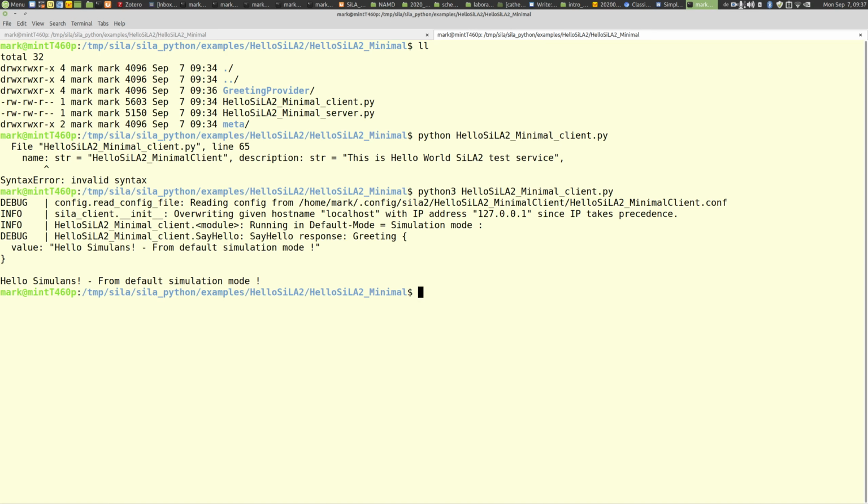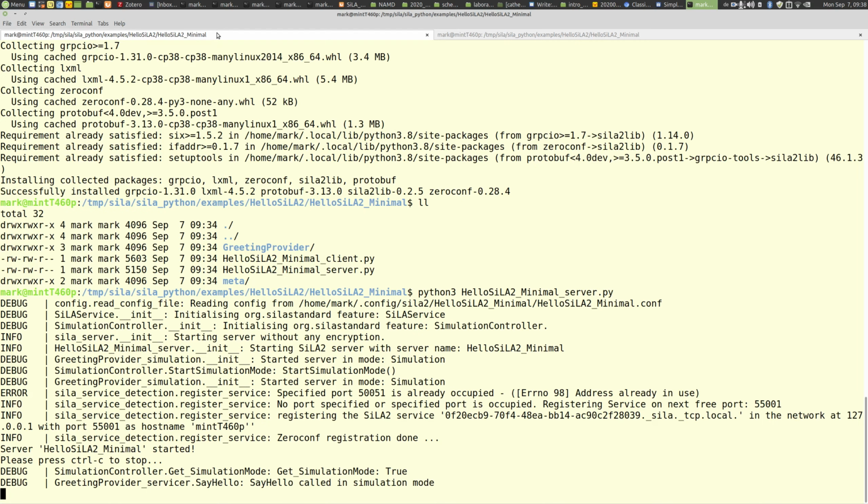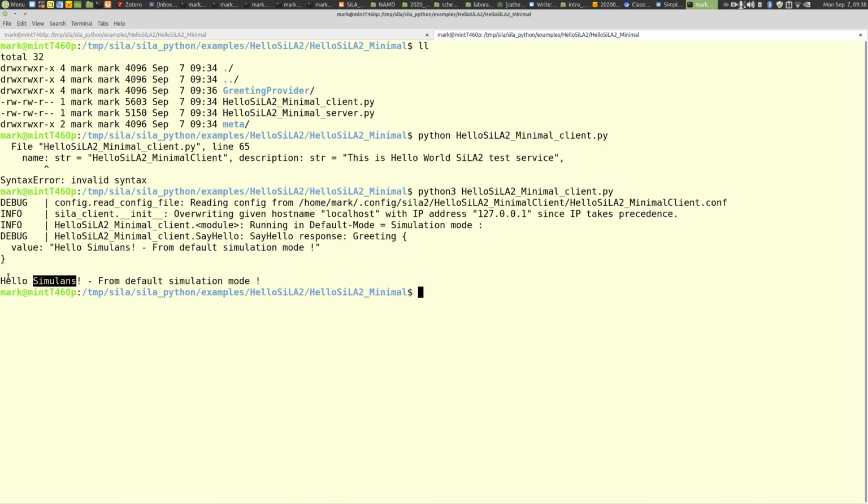And here's the output. So what happens is this client sends a string that is "simulants" to the server. The server generated a reply string, "hello simulants", and this part here, and sent it back. That's all. So if you would like to change that behavior, you can just modify the client.